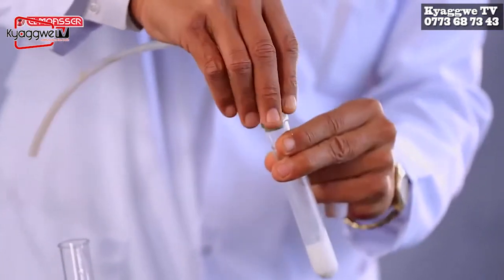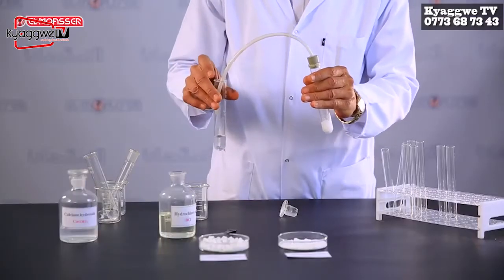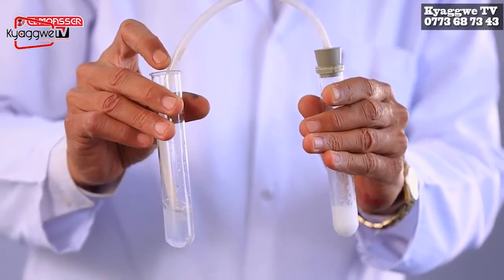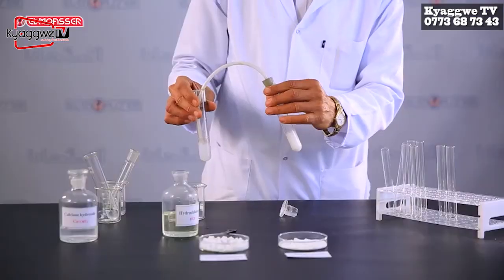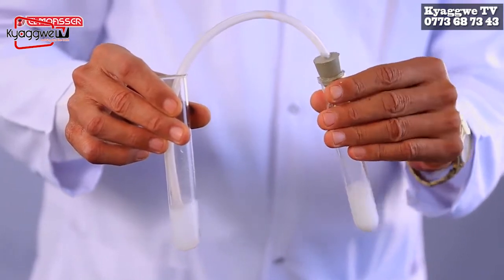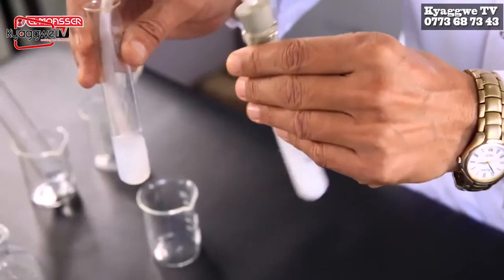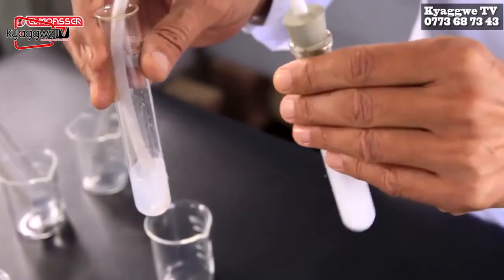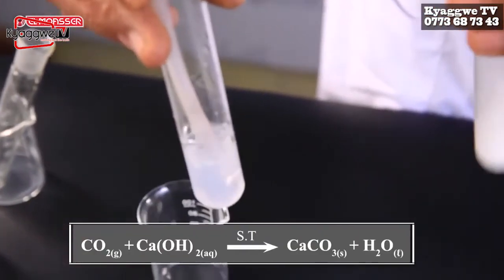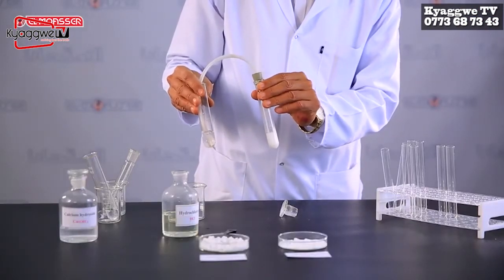We shall also put sodium carbonate in a test tube. We shall add there hydrochloric acid. Now, after adding quickly, we shall put a stopper so that we trap the gas that is coming out. We direct it into the other test tube with lime water. Watch very carefully. The gas is bubbling and the solution is turning from colorless to a milky solution. This shows that the gas coming out is carbon dioxide.